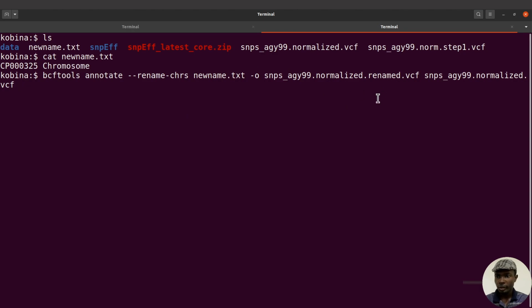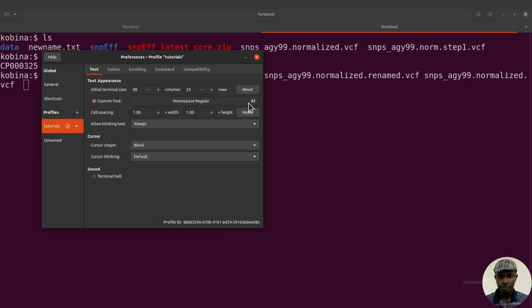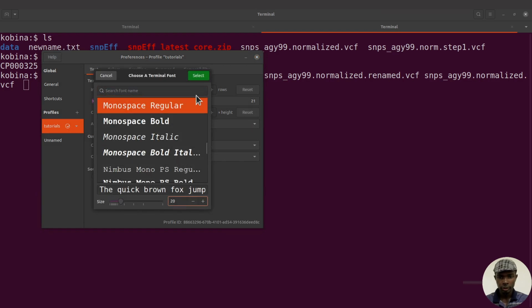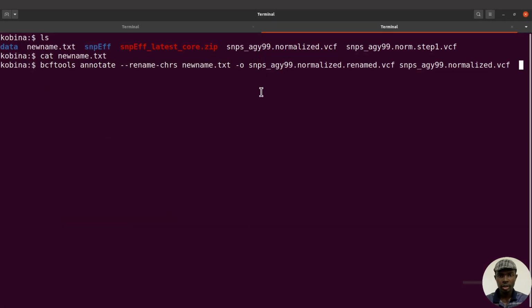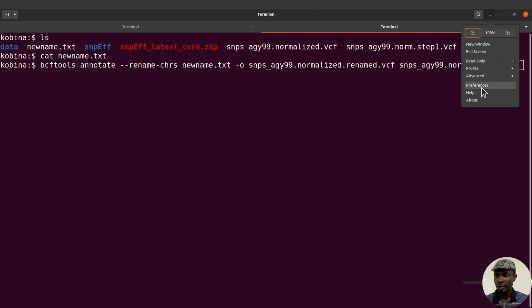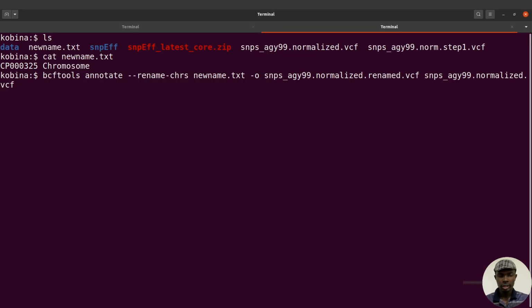Let me just reduce the font size a bit so that we can have them on the same line. Okay, so this becomes the final command to rename the chromosomes. All right, so that's what I thought I would let you know. So now we can execute this command. I'll revert back to the first slide. Okay, so now let's execute this command to rename the chromosomes. Perfect, so we have done that. Okay, so the chromosomes have been renamed.